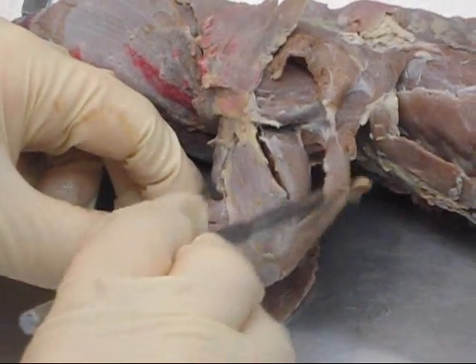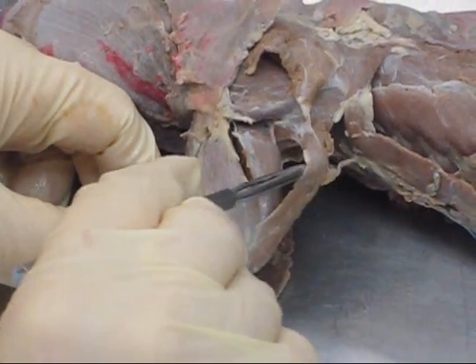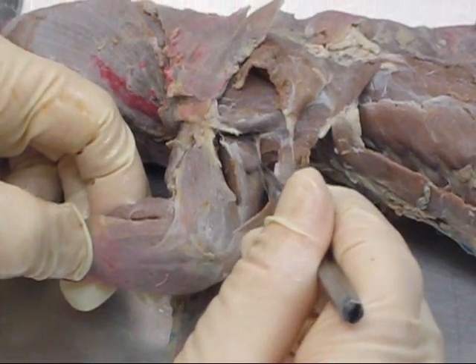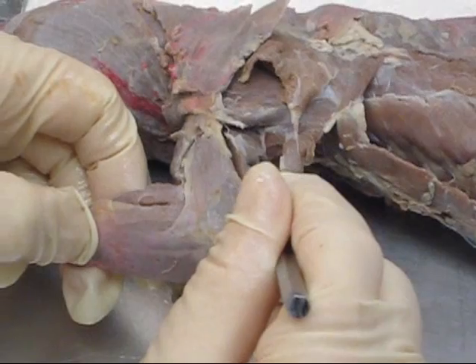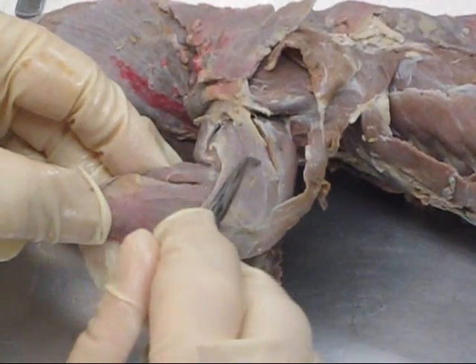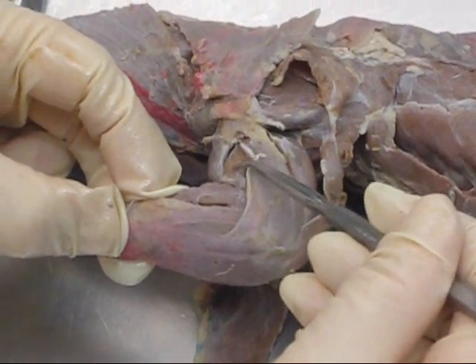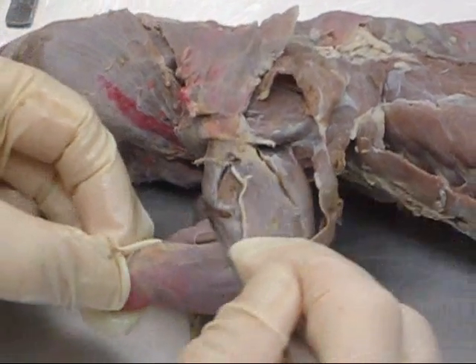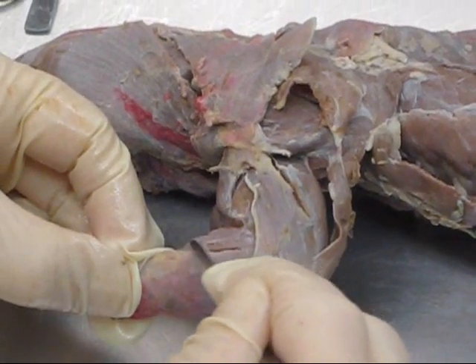In the mink's arm we also see some lateral muscles. First, everybody's favorite long-name muscle: dorsal epitrochlearis. Then triceps long head — not the medial head, not on this side. This is the triceps long head, triceps lateral head, hiding right in here. This muscle right at the very tip of the probe — that's the brachialis. Then here in the mink's forearm, this would be brachioradialis.